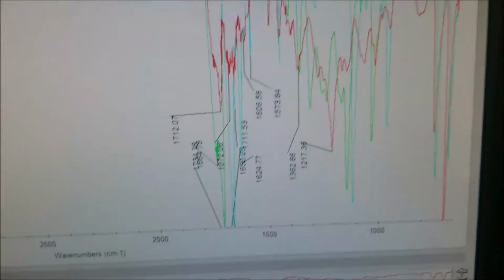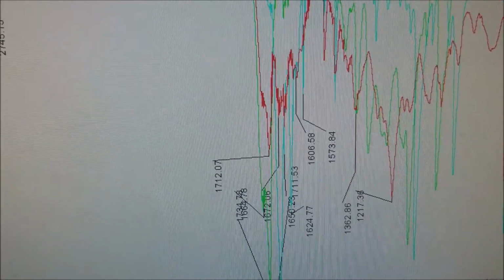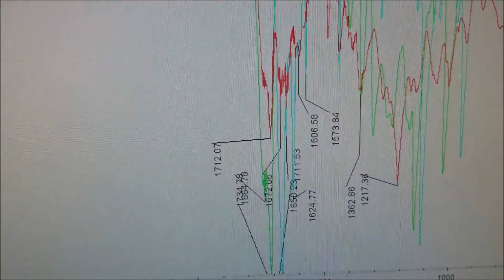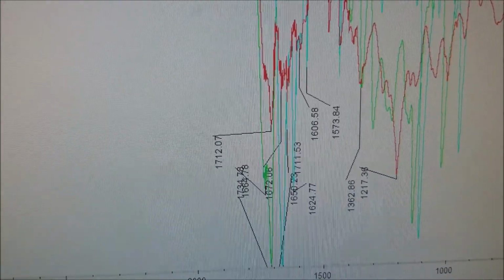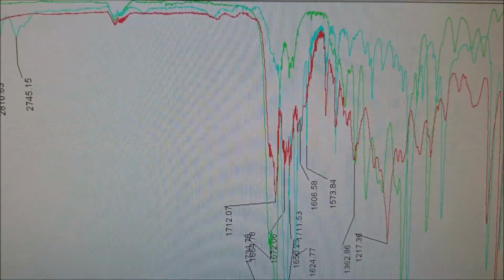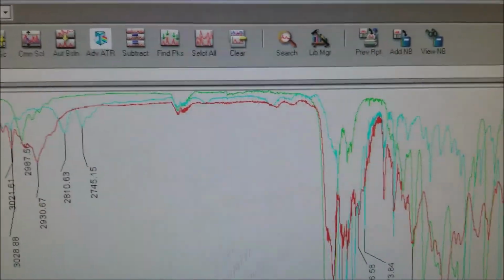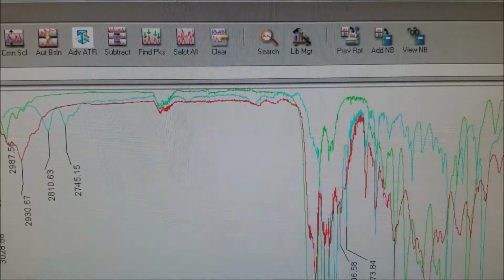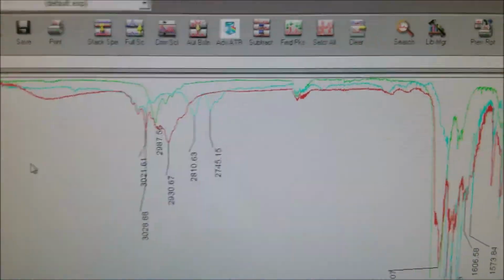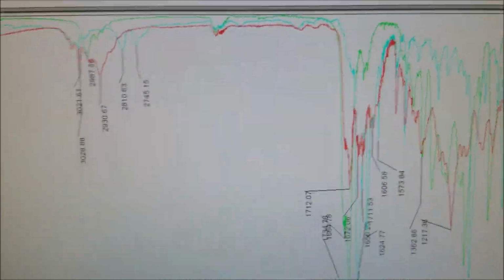So down here we see a lot of overlap from the ethyl acetoacetate, the green and the red, in the first C double bond O region. And we see some of the overlap from our trans-cinnamaldehyde with the light blue, suggesting that we have a mixture of the two, but it's not just one or the other. Because there's a lot of peaks we should expect to see that we don't see. So it's not just that we have both reagents mixed together.